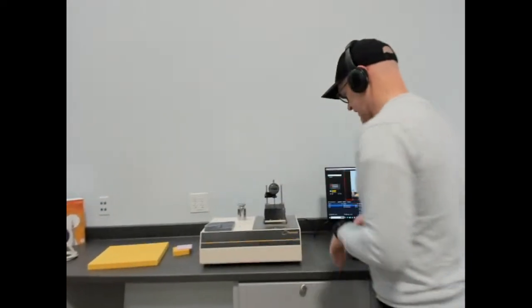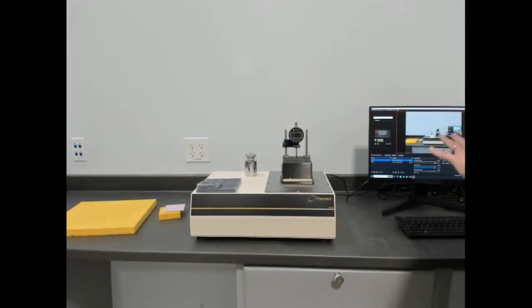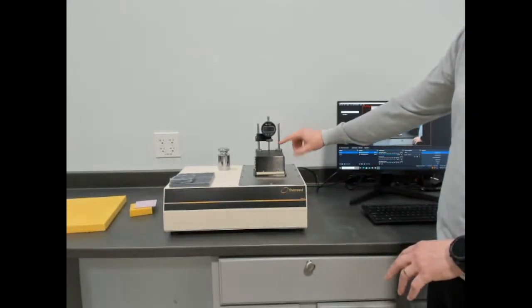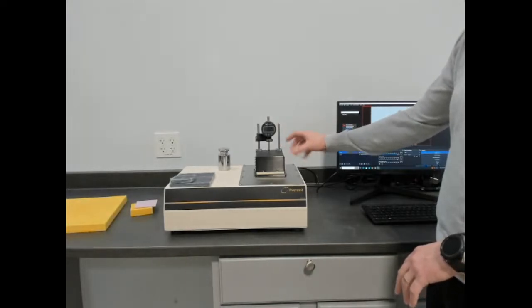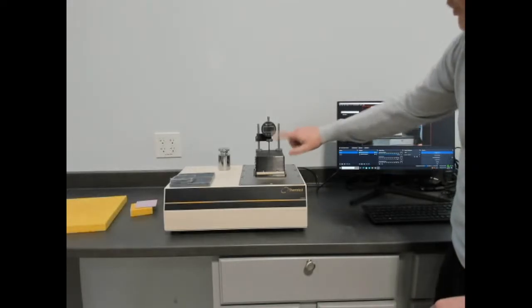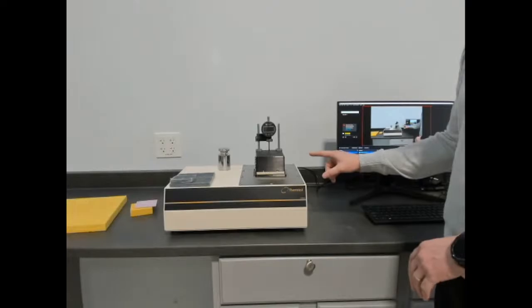So I'm going to just go to the other side of the instrument. Now, one step in the software is to make sure that we'll see it as a step, but I'm going to do it before I switch to the software. We're going to zero the digital thickness gauge, and that's done by just making sure there's nothing in it and it's clear of debris, and then pushing to 0. This thickness is a required input for the software.